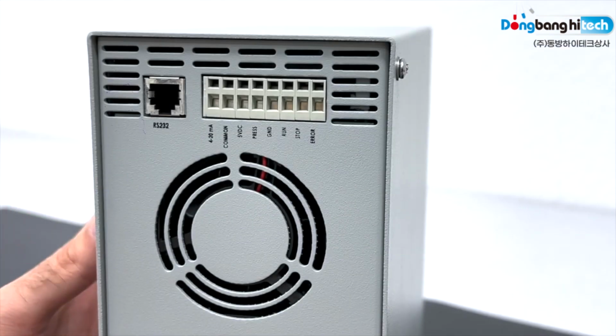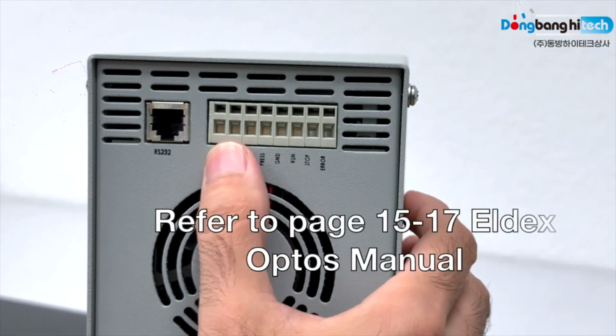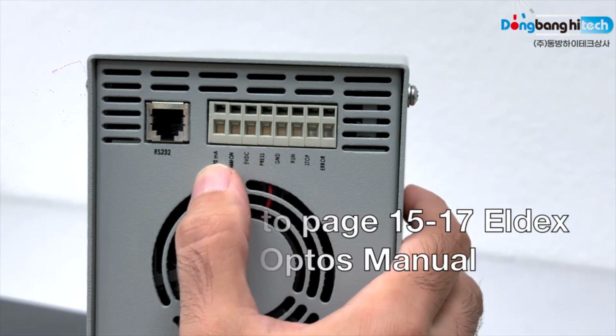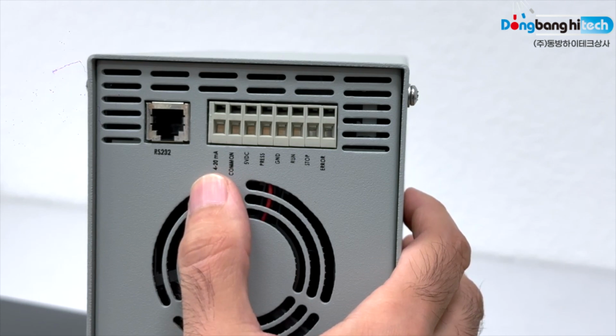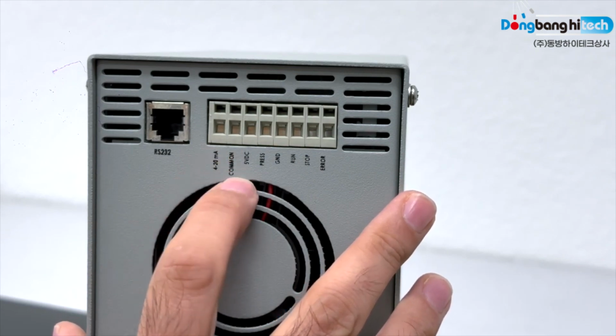In this video, we will show you the back panel analog input-output of the Optos pump. For analog input and output, there are 8 positions. Starting from the left, position 1 is 4 to 20 milliamp. This allows for remote control of flow rate using 4 to 20 milliamp current loop. Wire signal to position 1 and common to position 2.